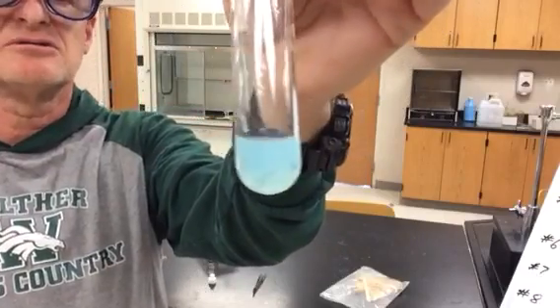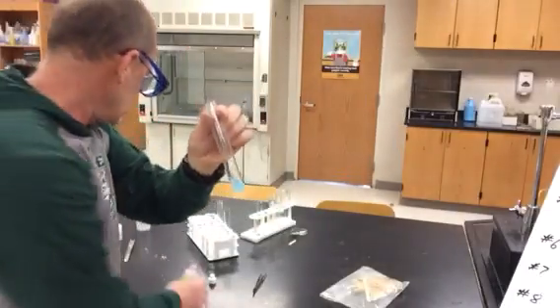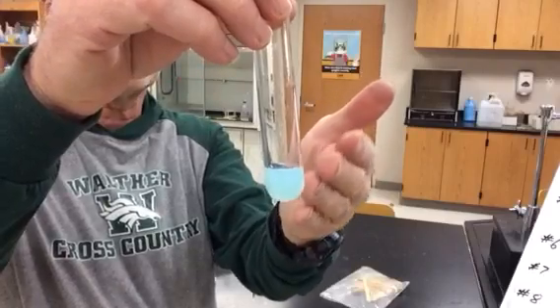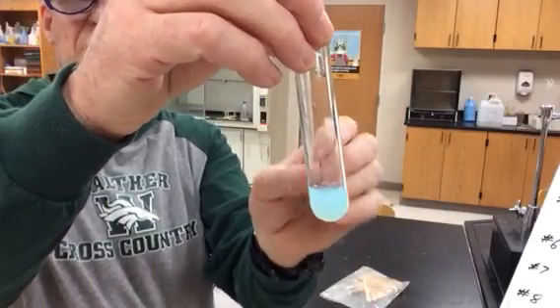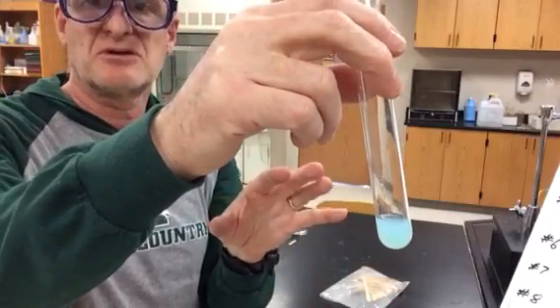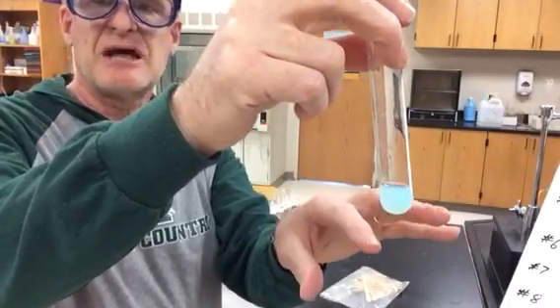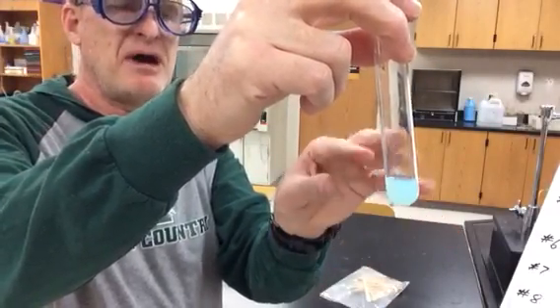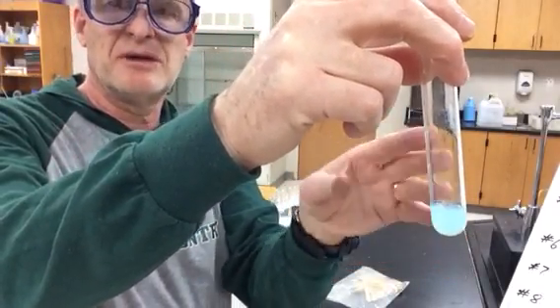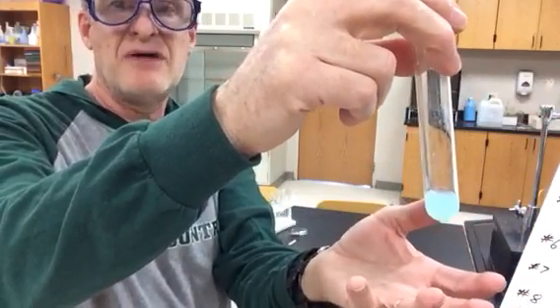And you'll notice that it turned cloudy. Now, things that turn cloudy are generally turning cloudy because they have a fine precipitate, a solid that's kind of floating around in the liquid. Remember, precipitate was a term that we used to describe a solid that is produced. So we're going to indicate that I've got a solid being produced here, a fine powdery thing that's kind of floating in the liquid. If I let that settle for a few minutes, we might be able to see that solid being pulled down by gravity, make it a little more obvious.